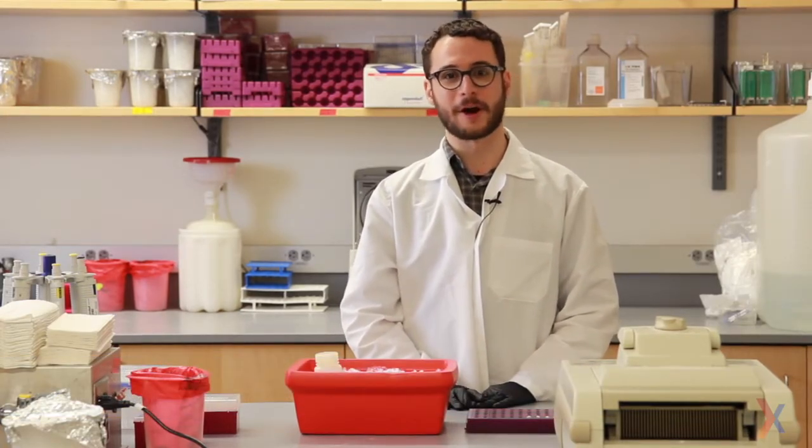Hello, my name is Paul Schwein. I'm a graduate student here at Harvard University and I'm going to tell you how to run a PCR.